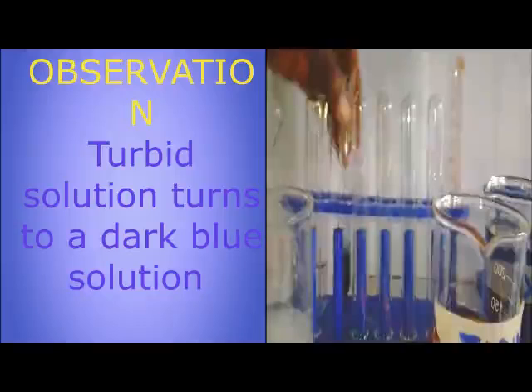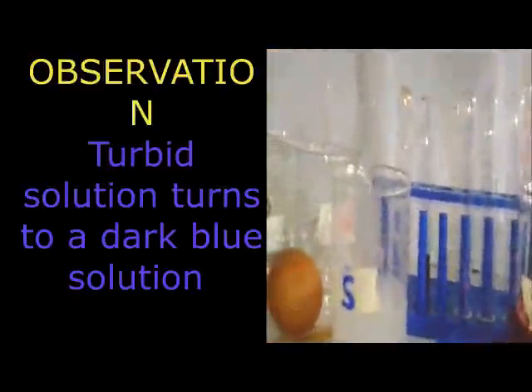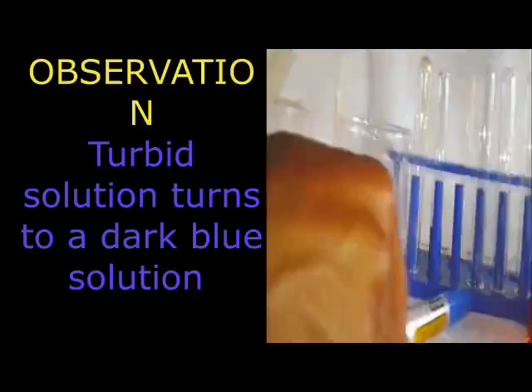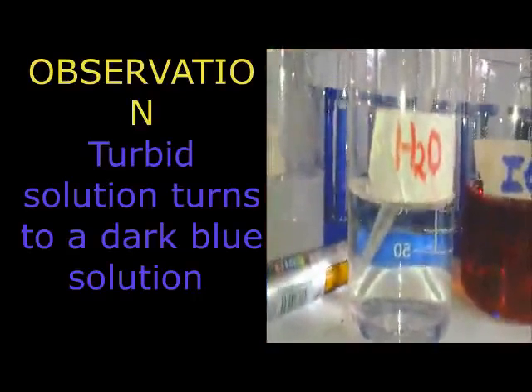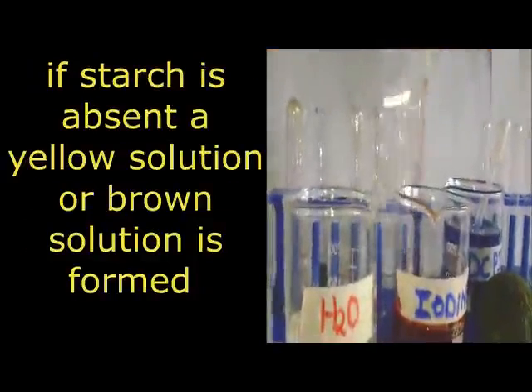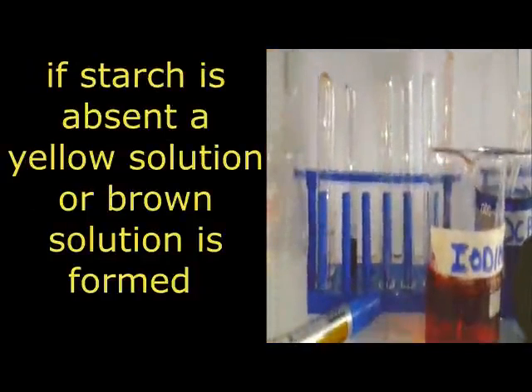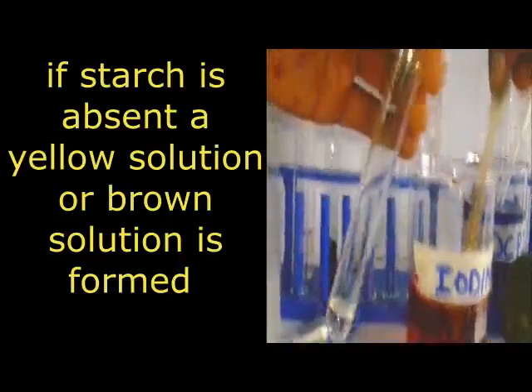Avoid using chemistry language. You can just say starch present. Now, I can do a negative test to show you that the reagent doesn't turn darker blue every time. We can do a negative test here using water. When I get my water, you can see your water. Then I put in my solution, which is my water. Already you know it. Then, after doing that, I also transfer the same iodine as I've been doing. So I get my iodine.